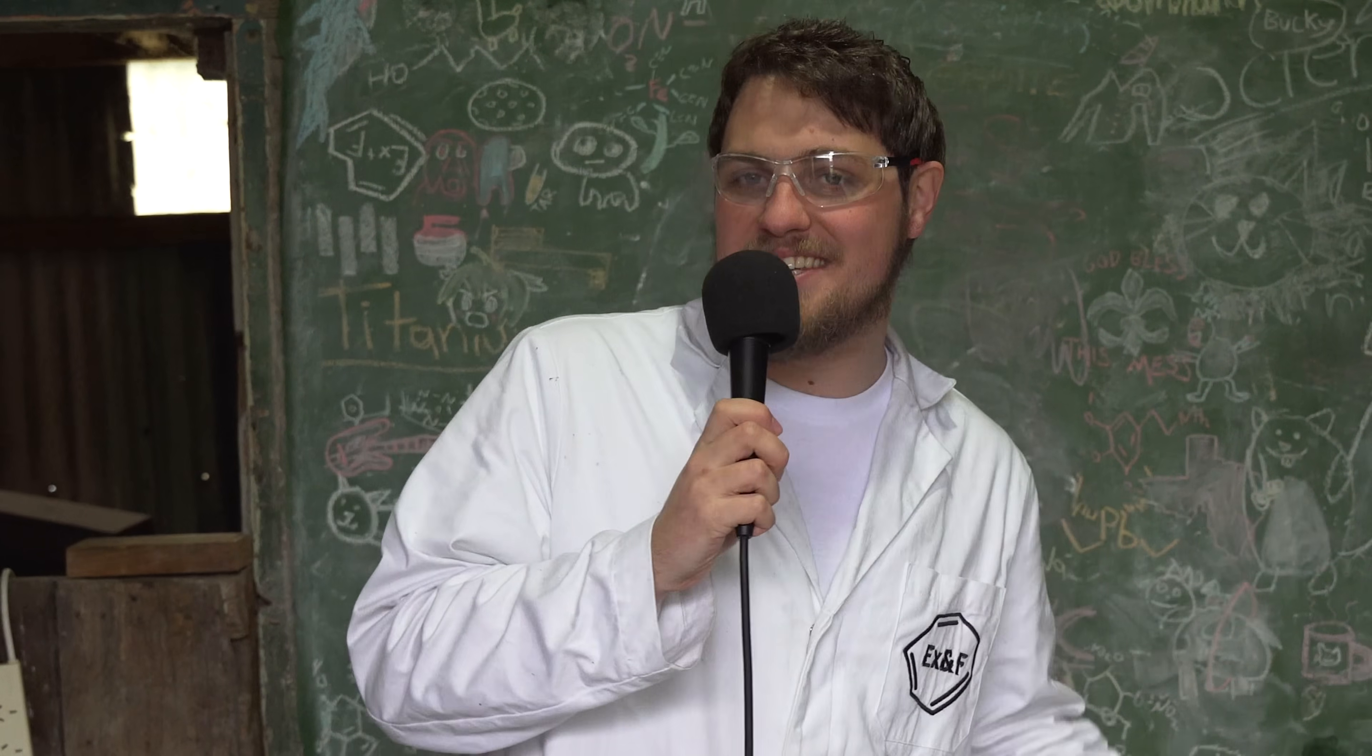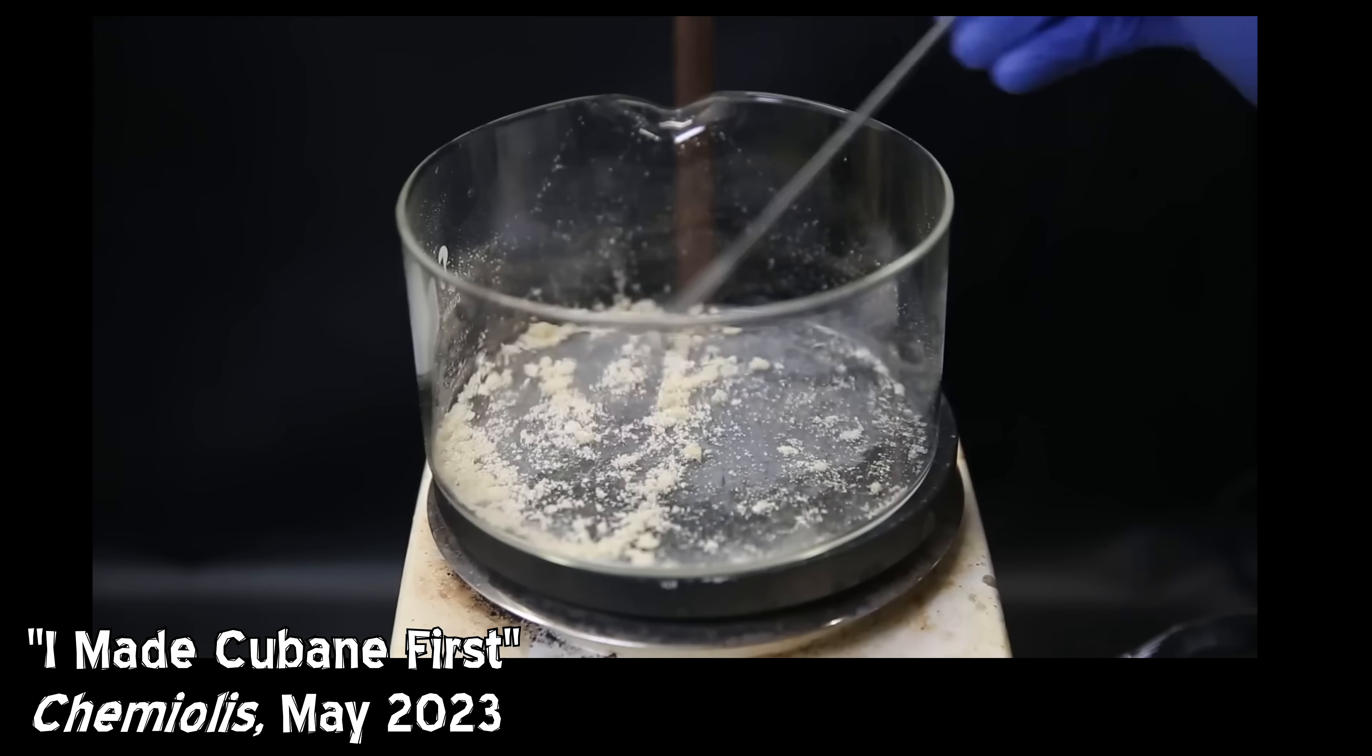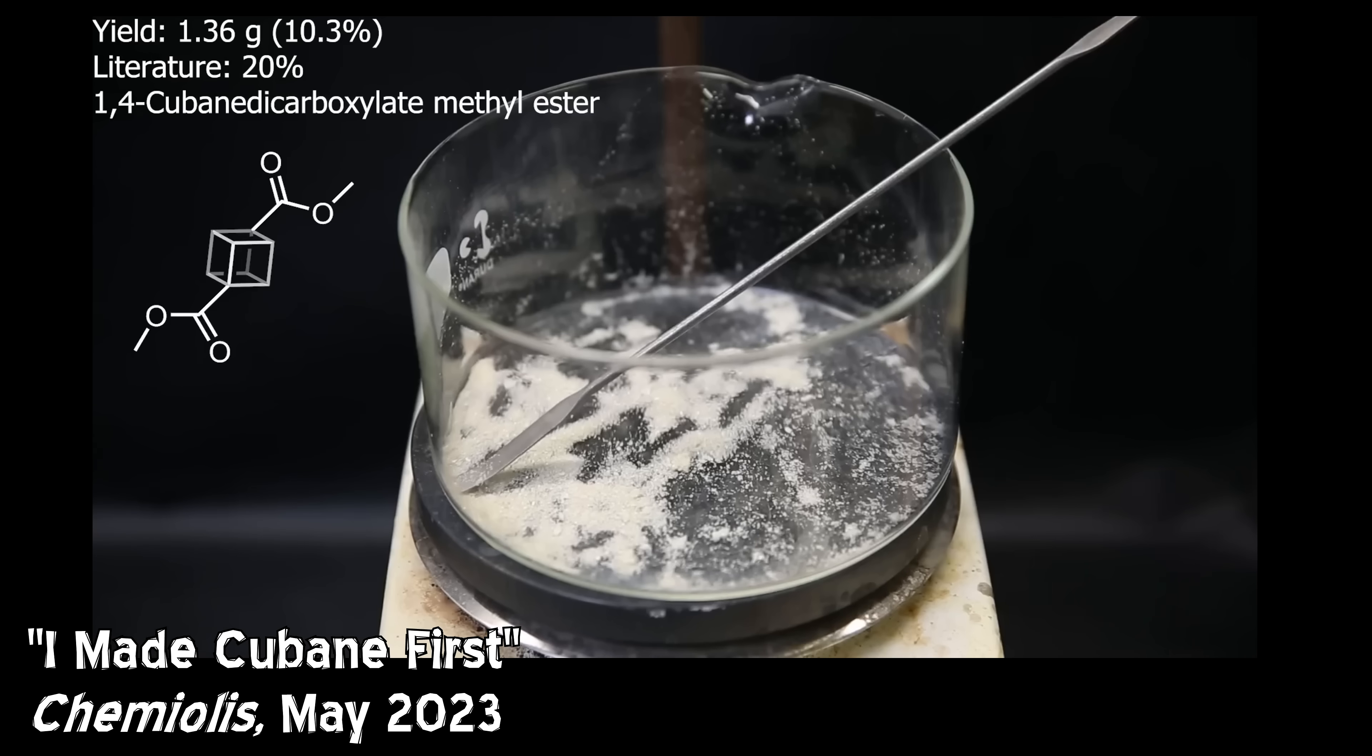Anyway, I wanted to start on some good news because I am left with an off-white solid, which is mostly 1,4-Cubane-Dicarboxylate-Methylester, which is also off-white in literature, aka slightly yellow.